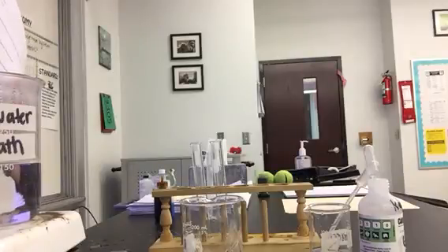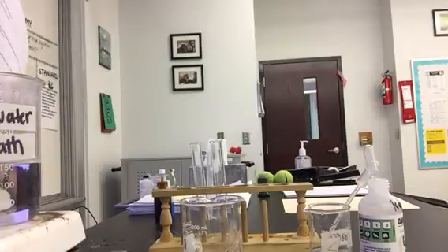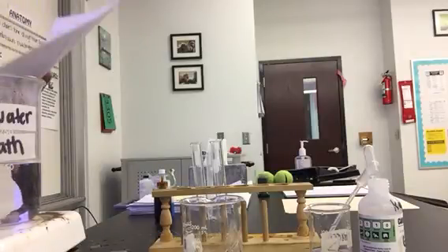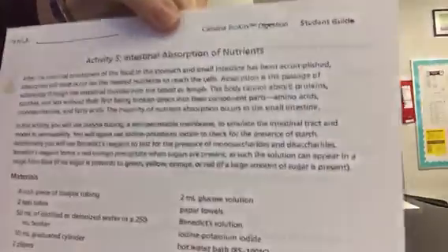This is for the intestinal absorption lab and you'll be using the intestinal absorption lab sheet. It looks something like this.